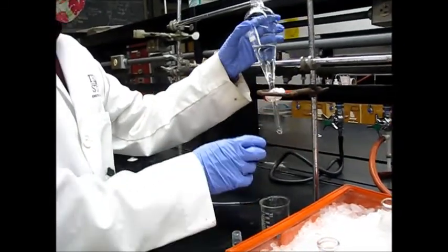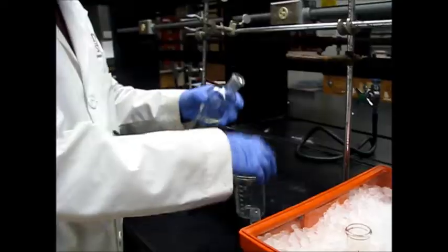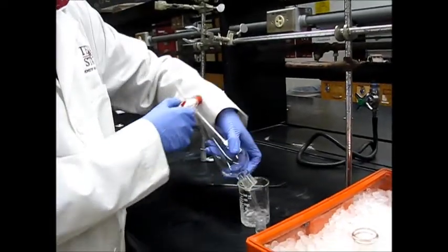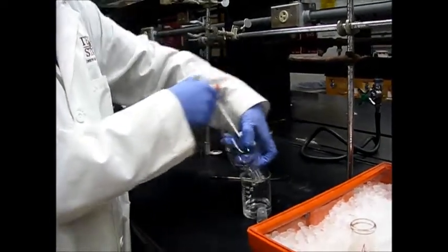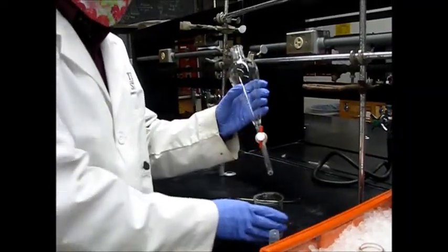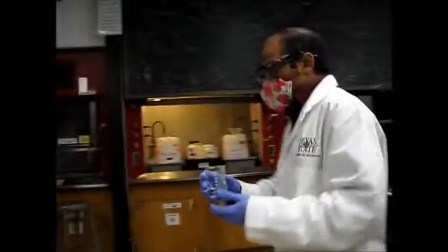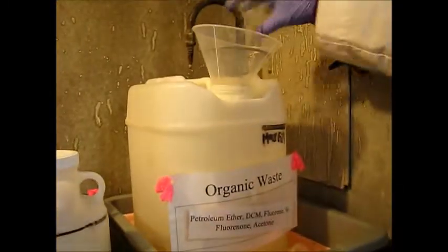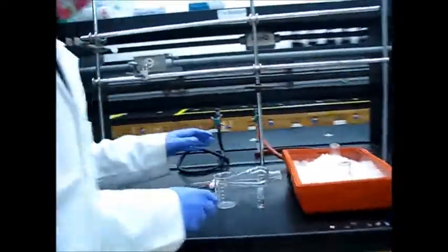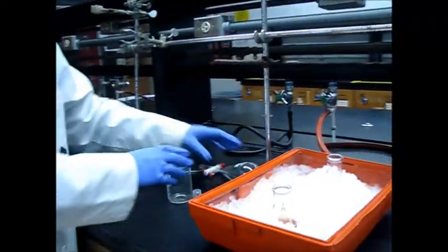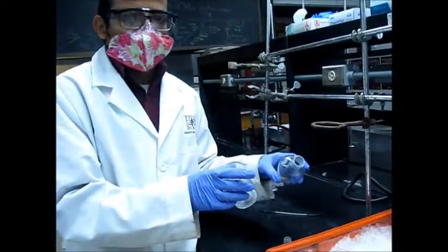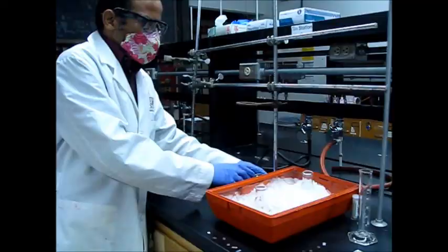You can rinse your beaker. Do not throw this into aqueous sink. You have to put this in the organic waste. So while it is precipitating we have to do cleaning of these glassware so that you can save your time.